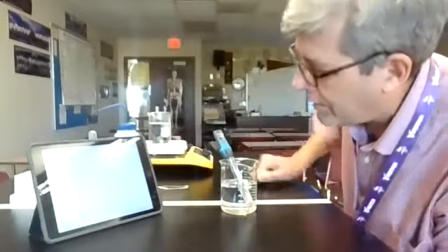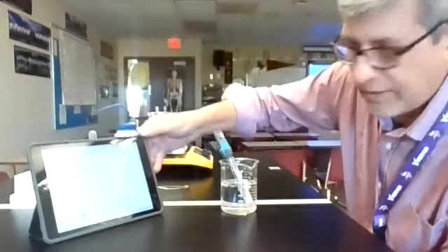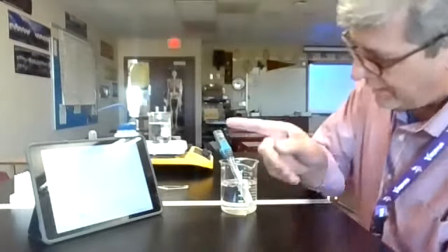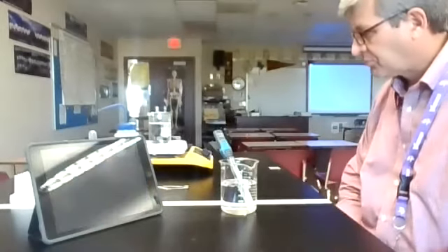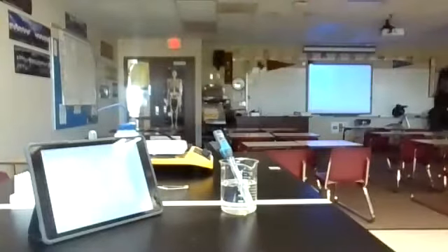And you're going to see a corresponding drop in the temperature pretty quickly until it starts to solidify. And when it does, and it's hard to see because it fogged up a little bit, when it does solidify, it should level out again for us. And you can see it's dropping pretty rapidly there. I'm going to pour this out.